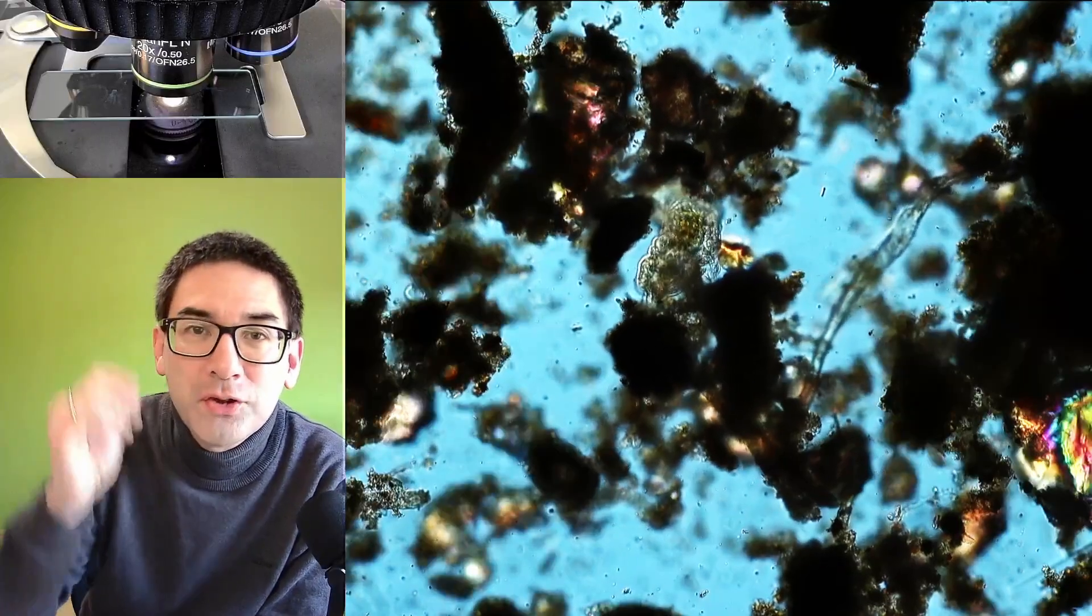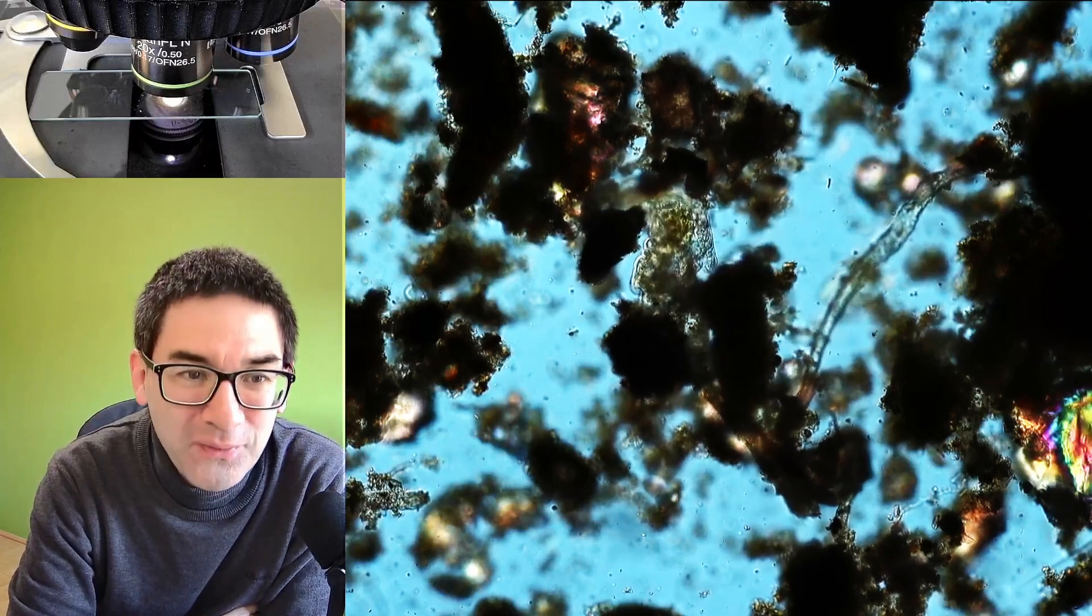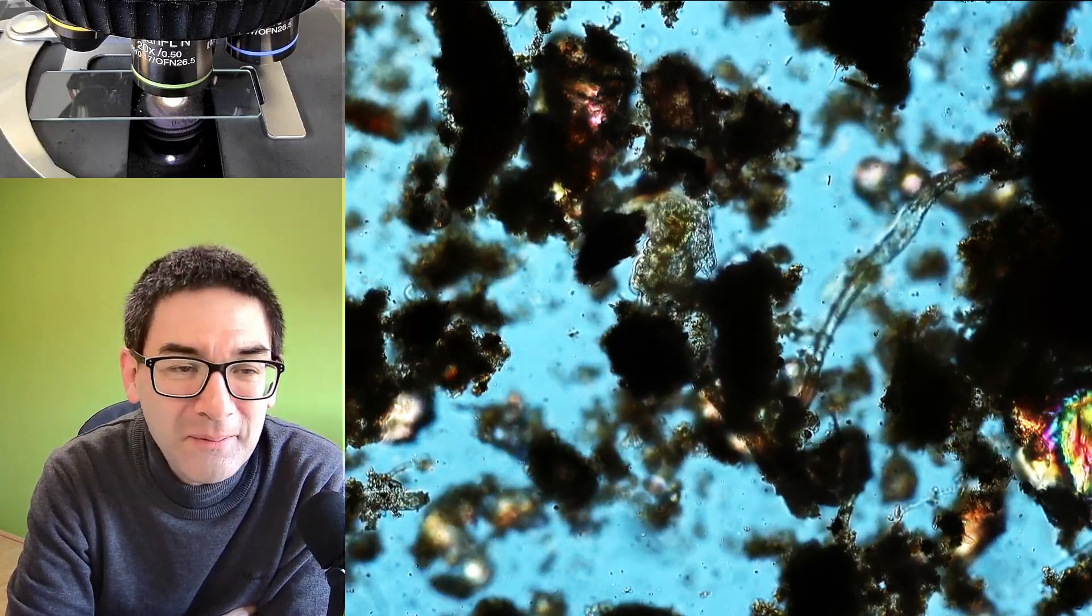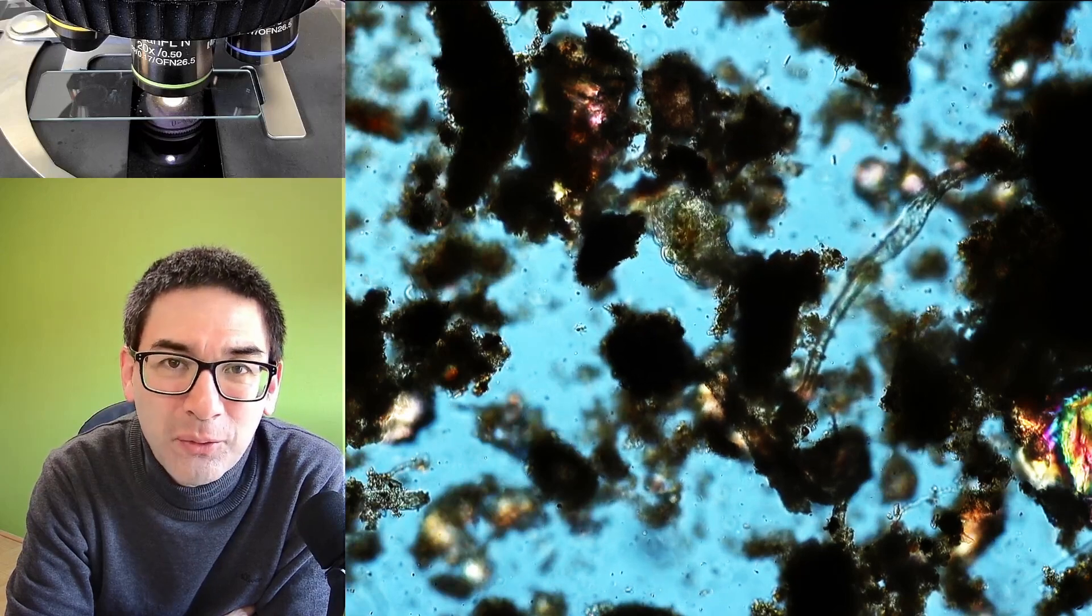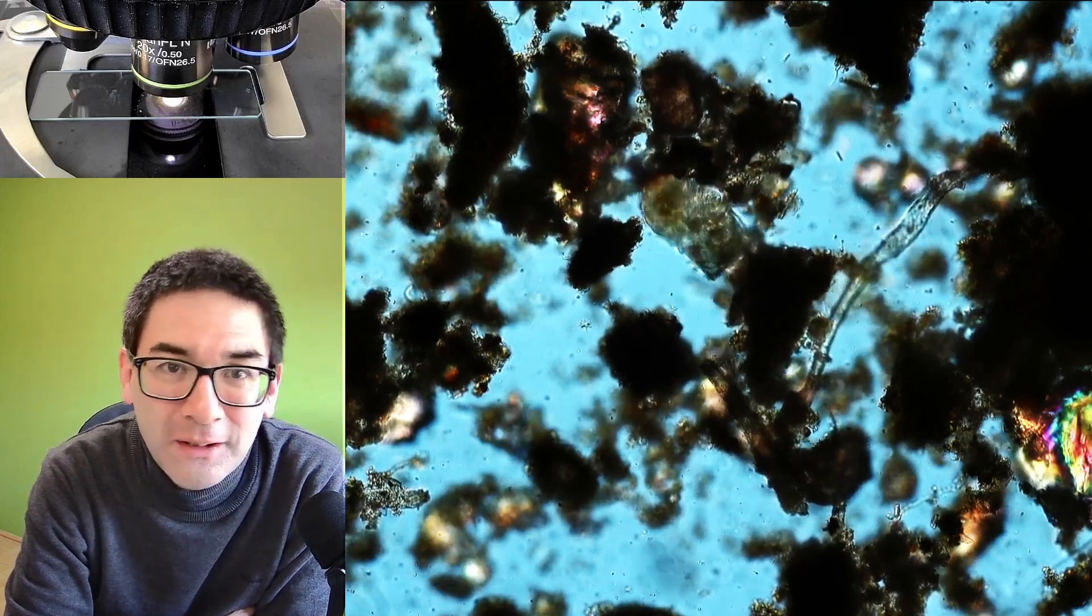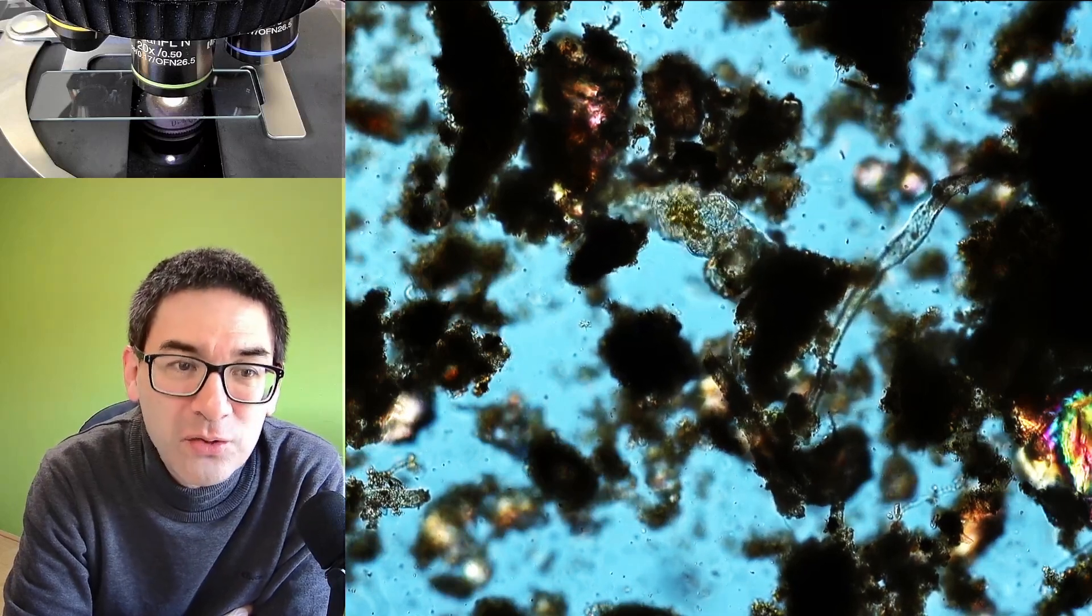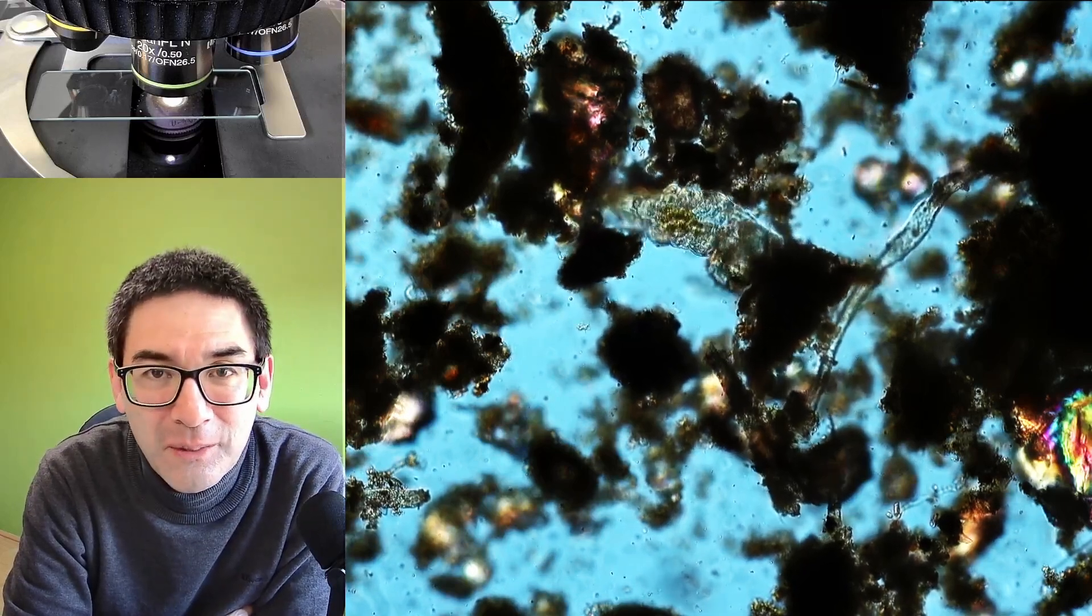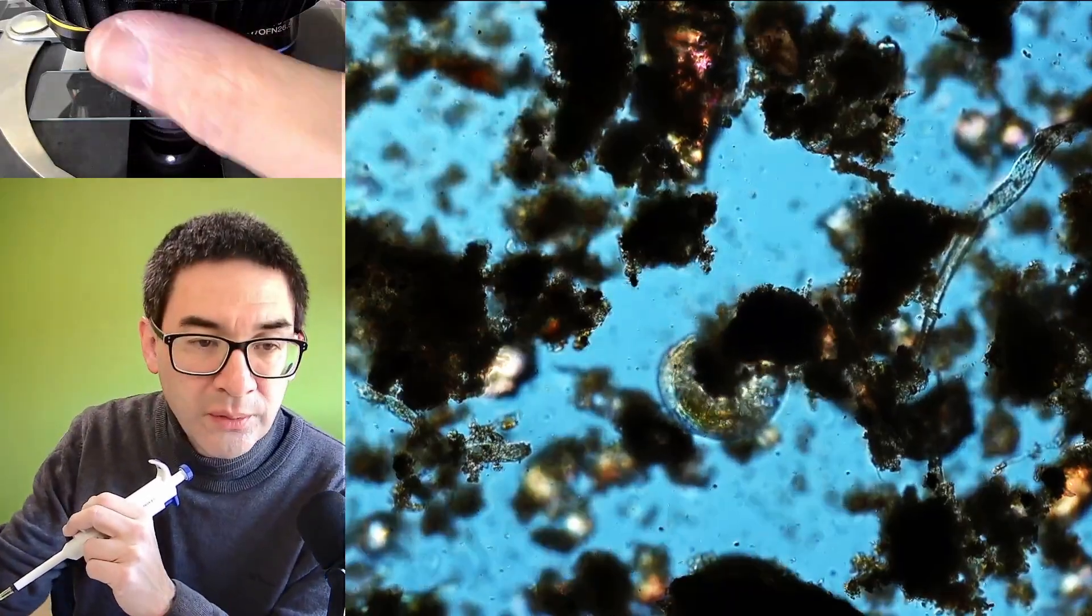Now you see a lot of debris of course. But if you're patient, here it is, I found a tardigrade in the moss sample. So we're quite happy about that. And what I'm going to do next is I'm going to try to use my pipette and try to pick it off and transfer it to a different slide where there are less soil particles and therefore I hope to be able to see it a little bit better.